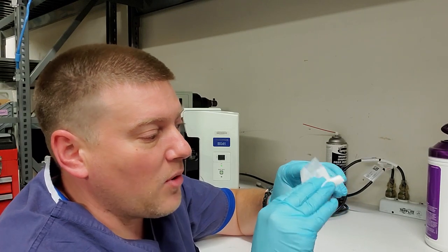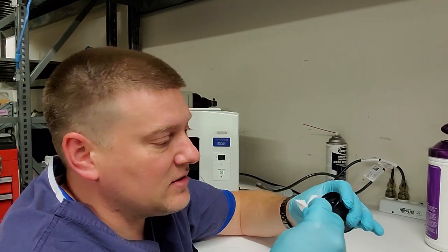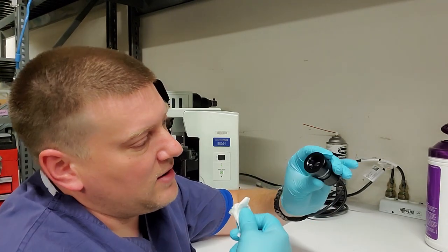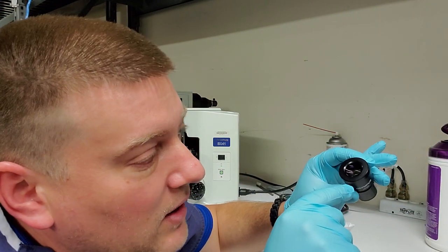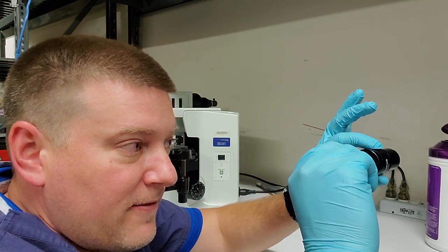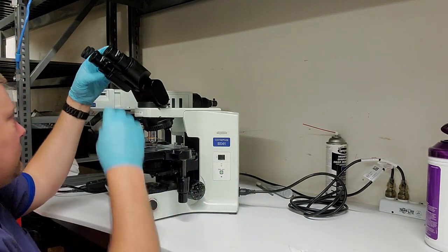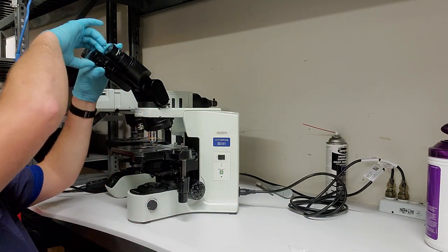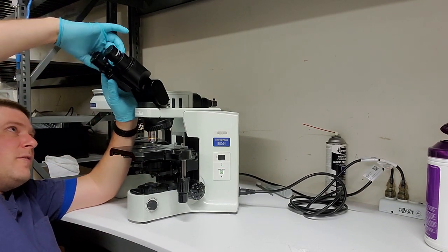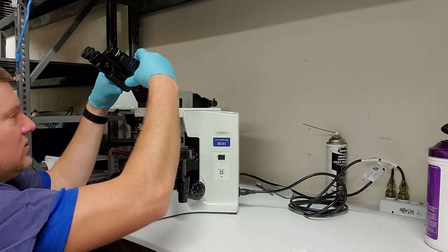So let's take my other ocular. I'm going to use a new piece of the rag. That's why I'm holding it very, very oddly, because I'm cleaning with one surface of it, and then I'll flip the rag to a new piece, and then I will slowly go around it. And what I'll do is I'll look up at the light at an angle, and you want to see if there's any debris, anything across the surface of the glass. That's why on that very last pass, I do a very slow spinning direction. Cleans, leaves a perfect finish on the outside. So you're going to check your binocular to make sure that your adjustment goes the full range, plus and minus. Okay, so this binocular is good.